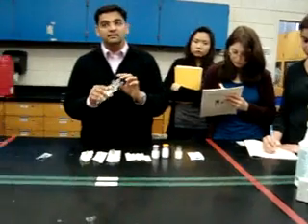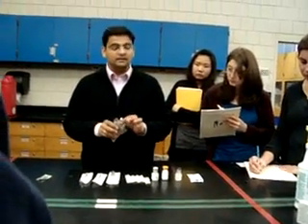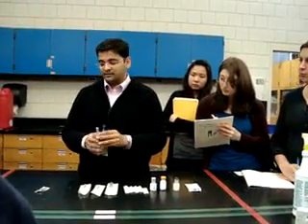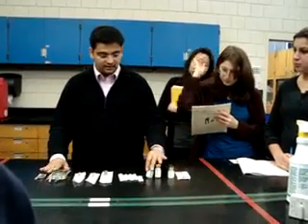Sometimes the bag is going to be sealed, so you have to remember to take out the seal. Whenever you work in a hospital, the bag is always going to be sealed. So you have to remove the seal. This is how you are going to set up.